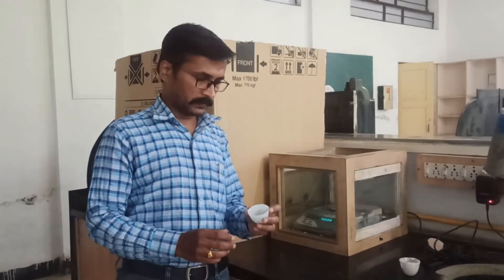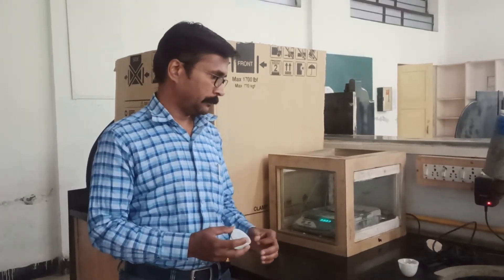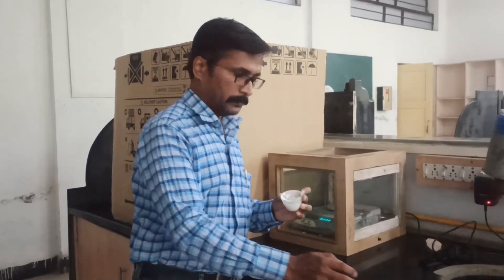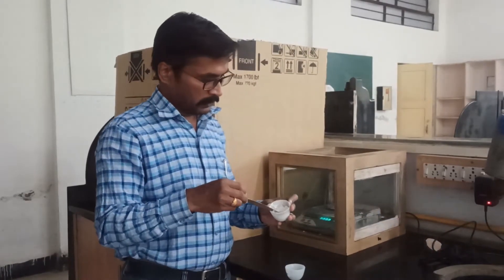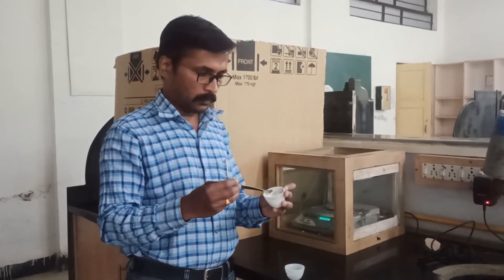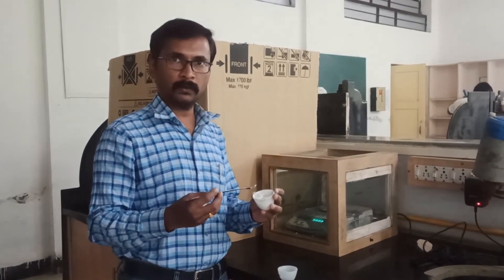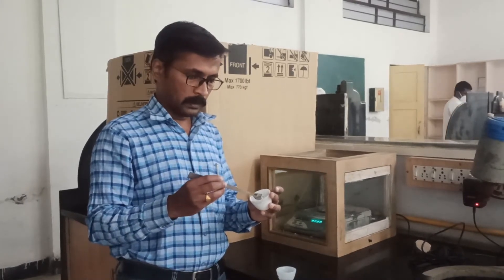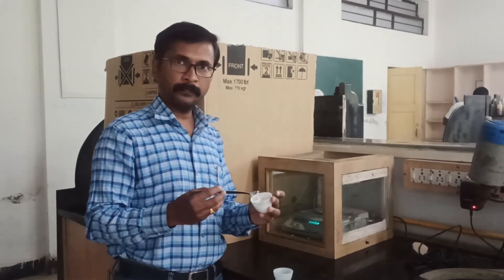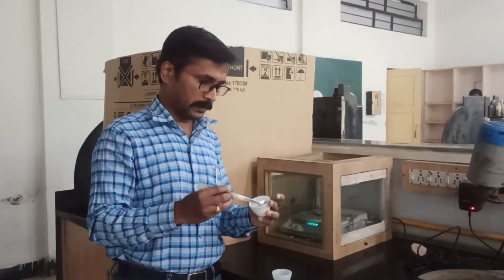In this session, we are going to measure the moisture content in a soap sample. We have sliced a soap sample. We have to measure a quantity of 5 grams of the sample and place it in a hot air oven for one hour. After placing in the hot air oven, the moisture contained in the soap will be evaporated.